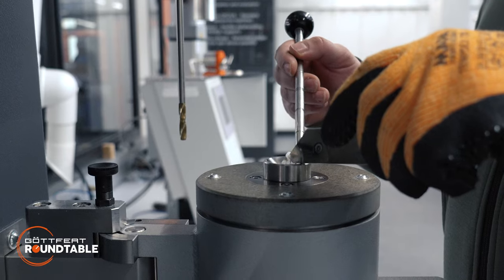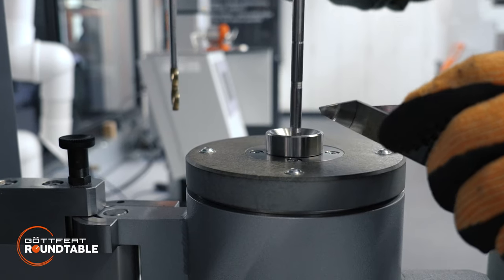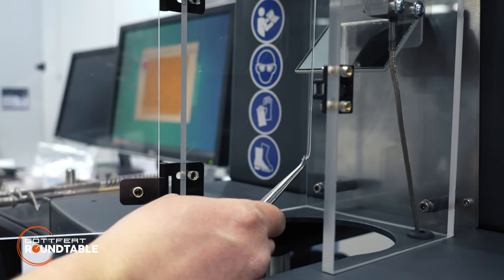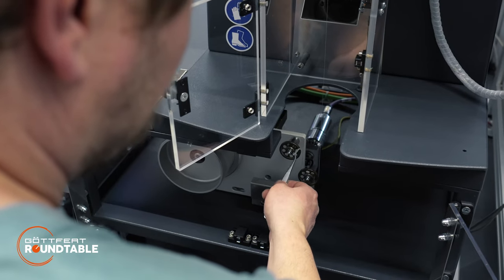Let's have a look at a test and how it's actually done. The test setup takes place in a custom PC software that's optimized for ease of operation in QC applications. You just select the product you want to measure and send the product definition over to the D-MEL system. Filling the polymer is the same as for melt indexing, and after a melting time of roughly four minutes, the big winding drum starts to turn. The operator winds the strand using tweezers, and after that the test runs automatically.